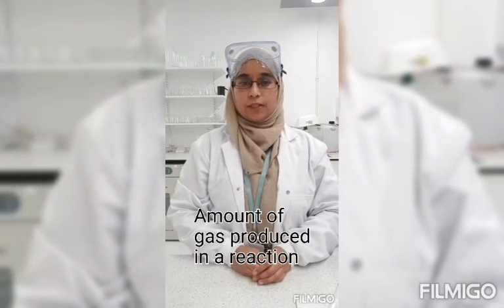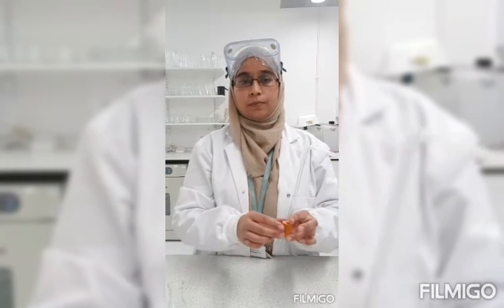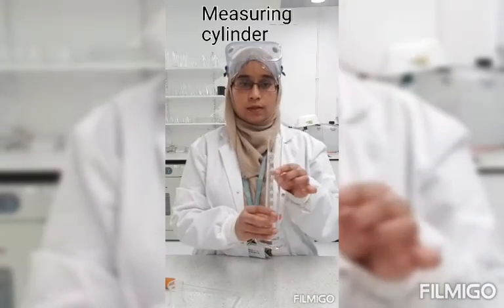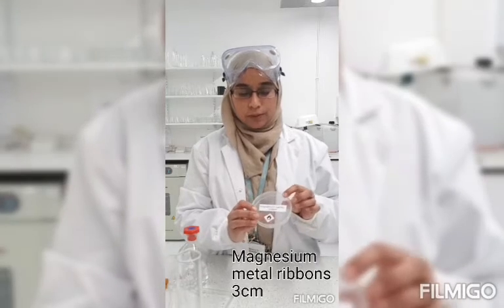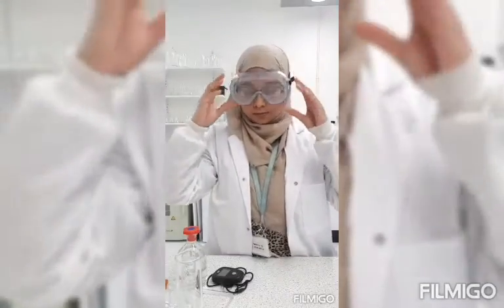For the second part of the practical, I will be measuring the amount of gas produced in a reaction. So I will need the following equipment: a white tile, conical flask, a bung, delivery tube, some plasticine and a syringe. I will also need a measuring cylinder, 2 molar hydrochloric acid, ribbons of magnesium metal measured at 3 centimeters, and a stopwatch. Firstly, I put my goggles on.